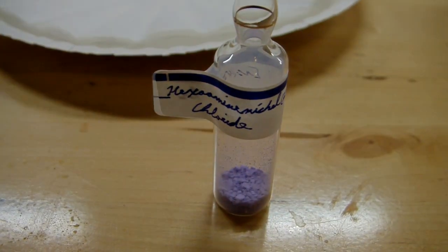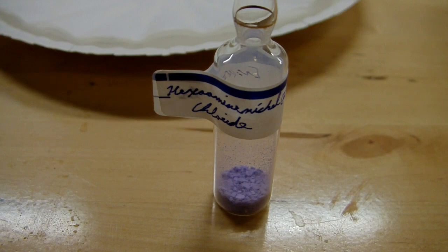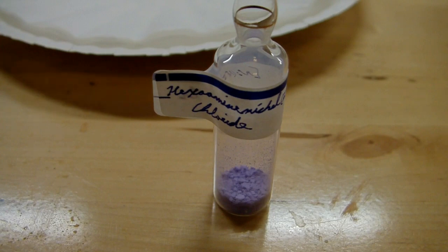So you may be wondering why I wanted to do this synthesis. What's the purpose of hexaaminenickel chloride? What's the use of it? There really was no purpose to be honest. It just sounded like a really cool synthesis that I wanted to try. There's really not a lot of purple compounds out there and especially not of nickel. Generally nearly all nickel salts are some kind of shade of green. So it's pretty rare to find a purple one like this. And it was a fairly simple synthesis that I could do easily and come out with a neat product.